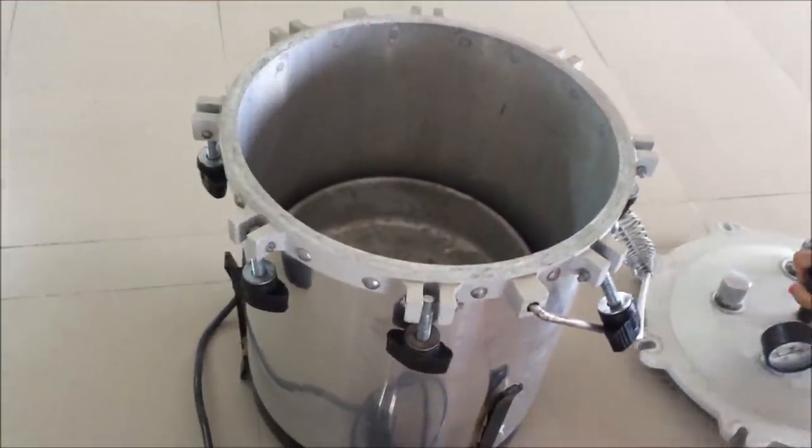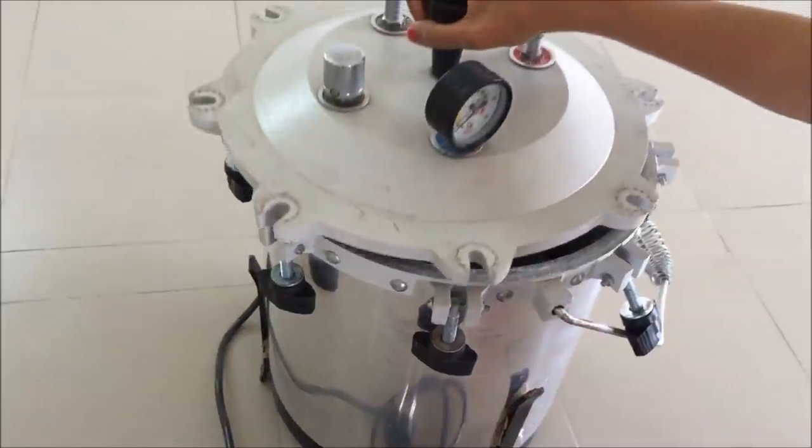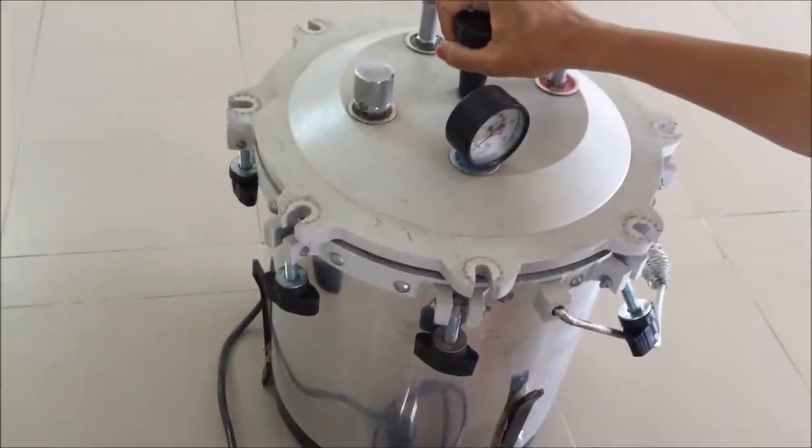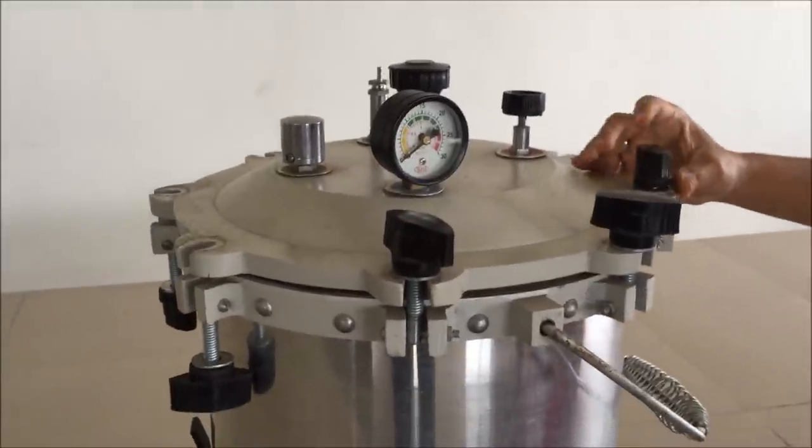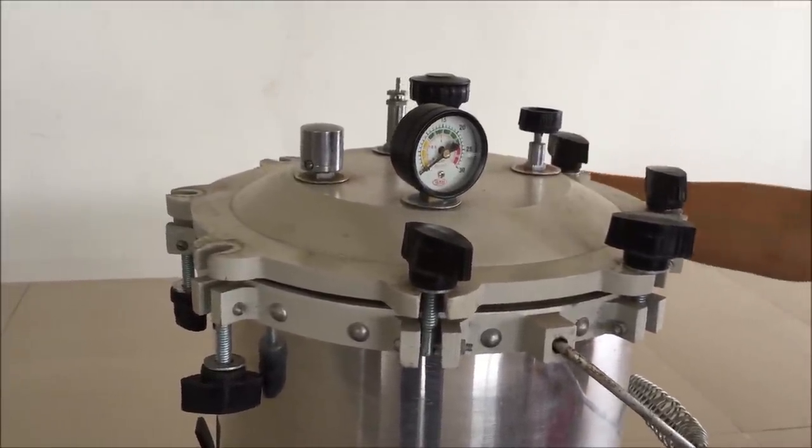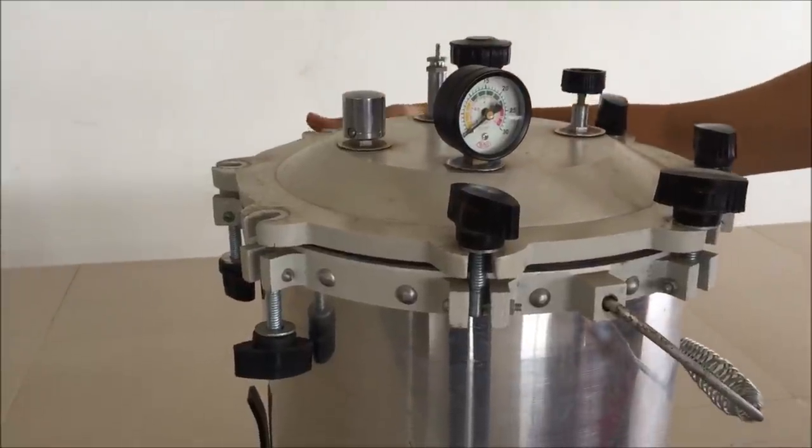Place the tray on top of the tripod stand. Place the lid on autoclave. Autoclave lid should be placed in its proper place. Otherwise there will be problem in tightening the screws.